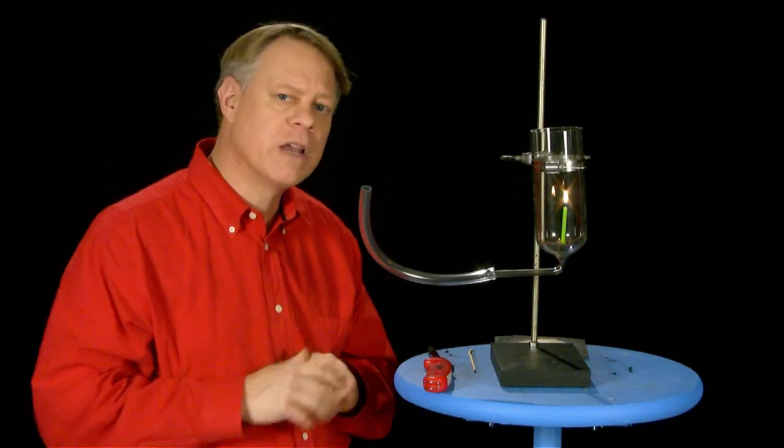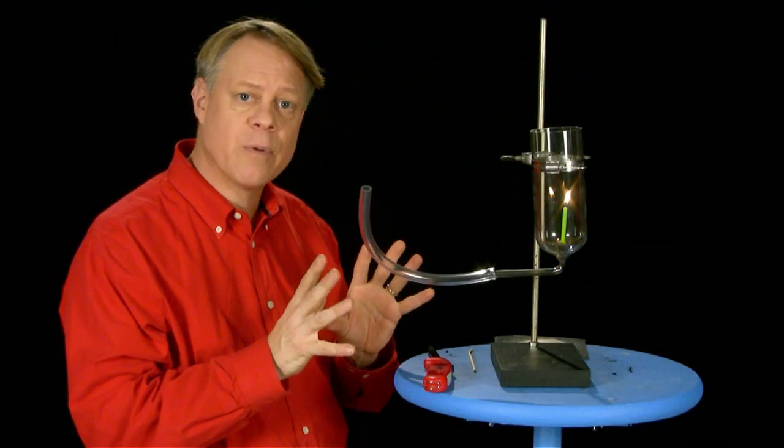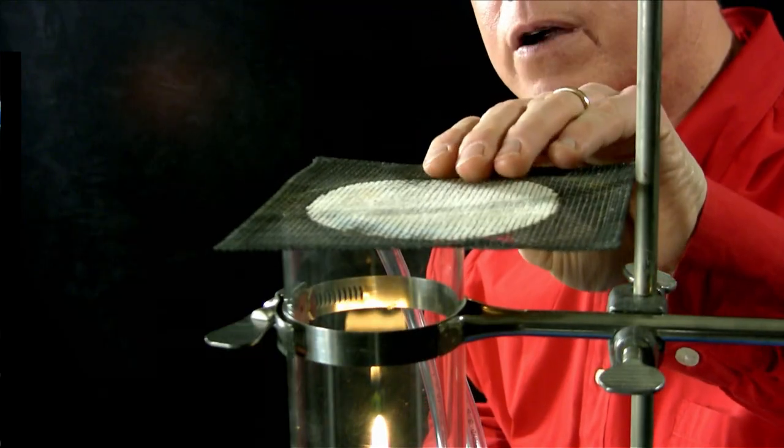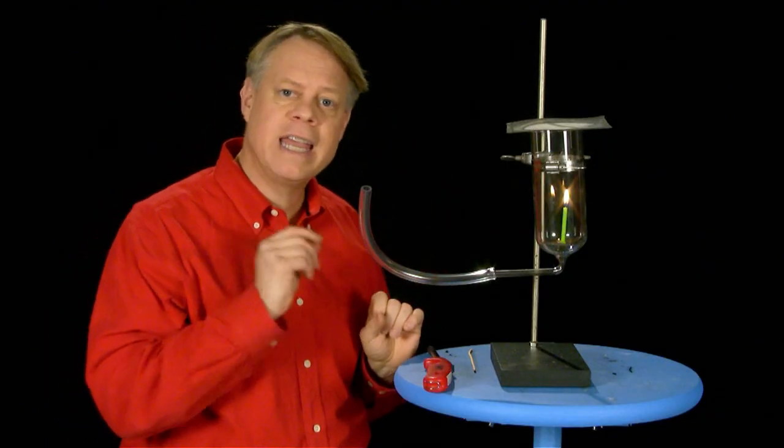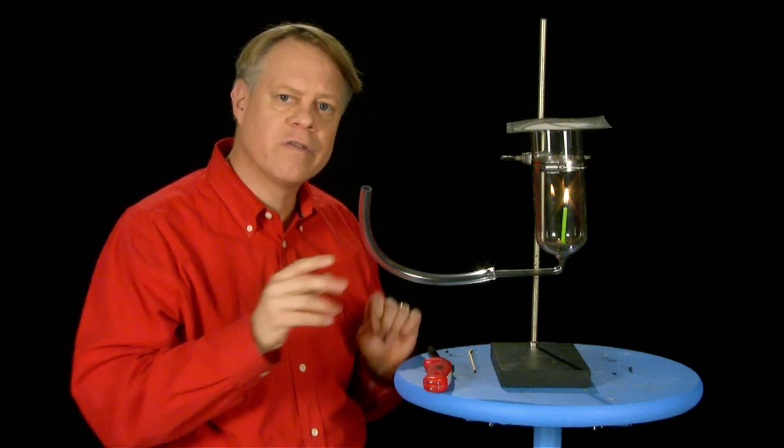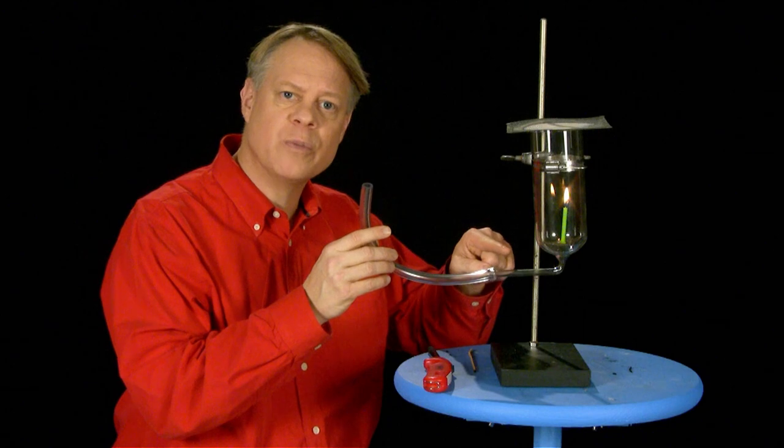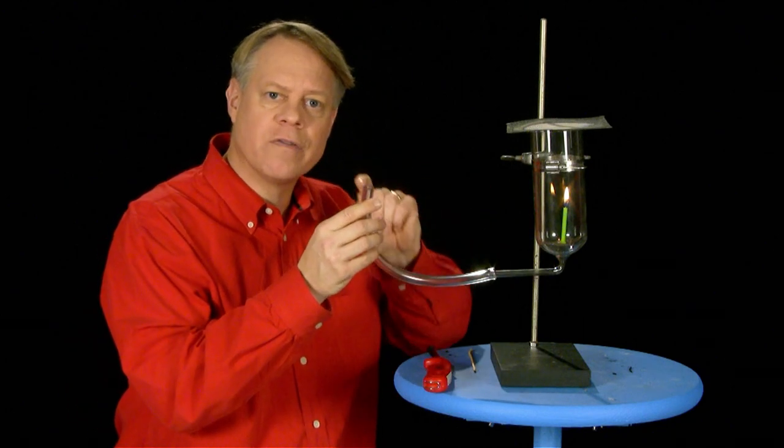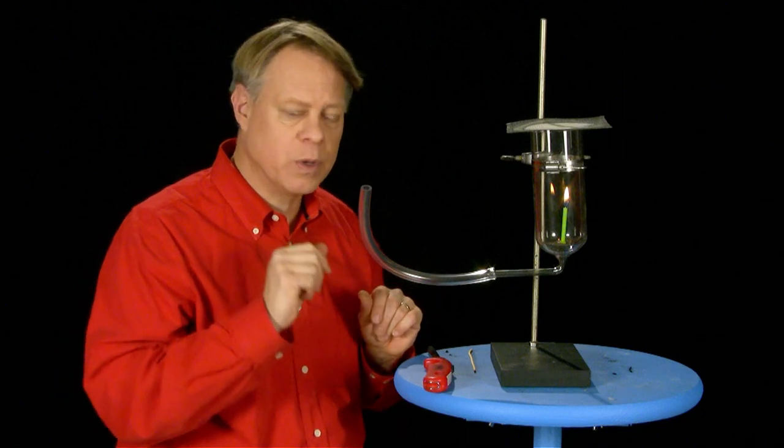In order to make the relation very plain, I have devised a little apparatus with an air inlet at the bottom, and I will limit the air flow out of the top with this wire mesh. The lighted candle goes on burning very well. You observe that the air which feeds the flame goes along the horizontal tube and ascends the vessel. If I stop the aperture through which the air flows, I stop combustion as you will perceive.